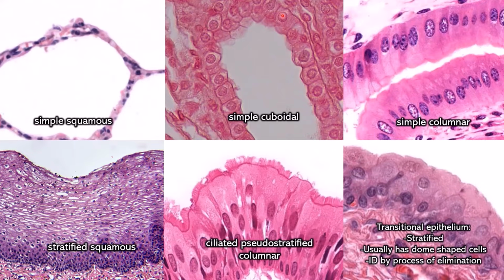Sometimes you see areas like this that look like multiple layers of cells, but that's just a mirage. That's just something about how they cut the slide. It didn't come out picture perfect, but when you've seen enough examples, you start to recognize mirages versus what the tissue is actually supposed to look like.